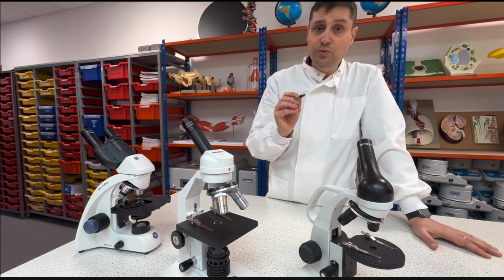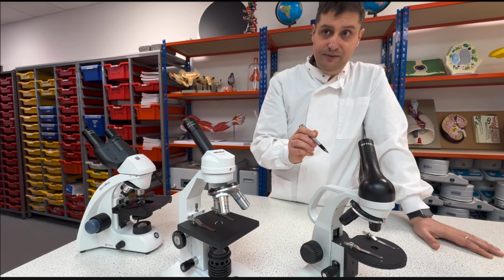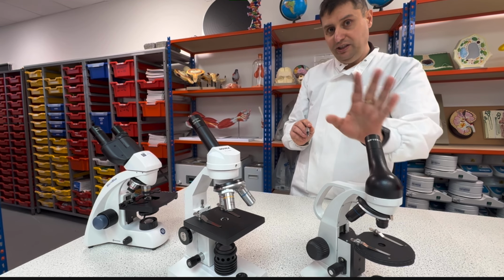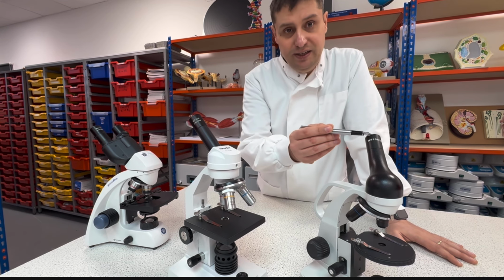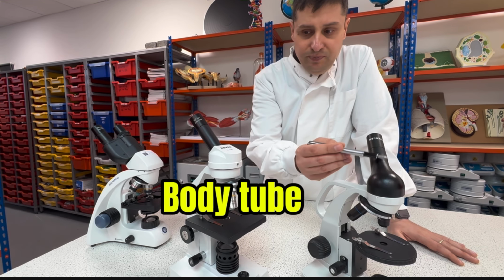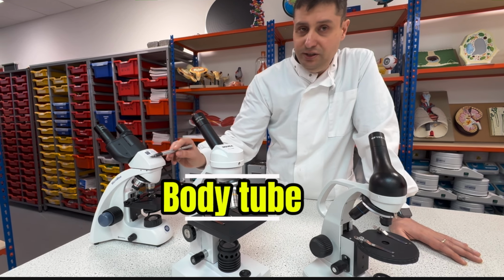But the microscope works with two magnification lenses. One in the eyepiece and the other one in the objective. We will talk about this later. So this is the eyepiece. This is the body tube.